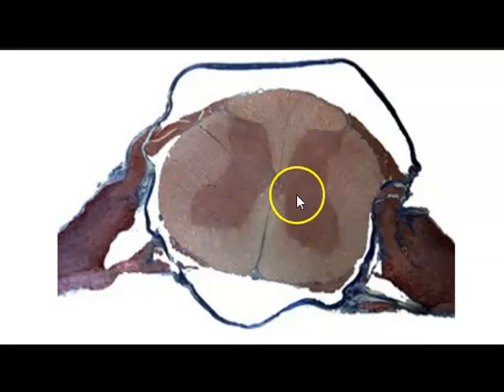So this is gray matter. Within the ventral horns, this is where you'll find your multipolar neurons. Within the white matter, these contain the axons of the neurons. Within the gray matter, we have dorsal horns, we have the ventral horns, and then we have this commissure. This is the gray commissure, and there should be a hole within the commissure called the central canal. Again, the central canal is important for the flow of cerebrospinal fluid.